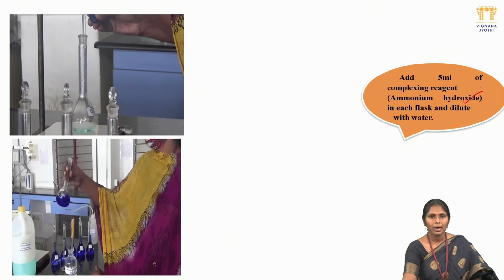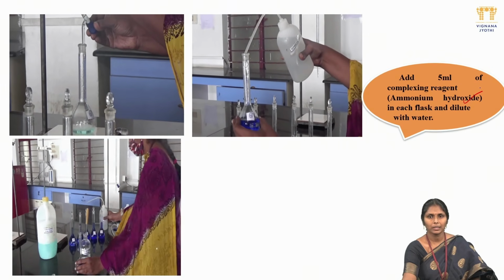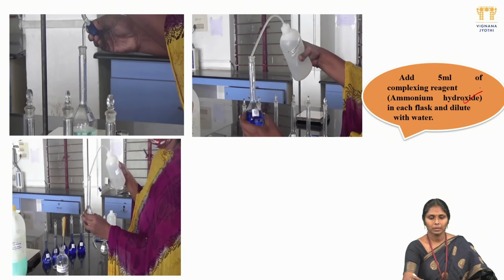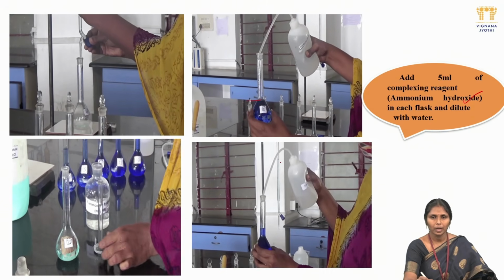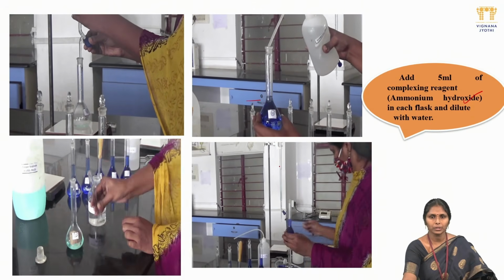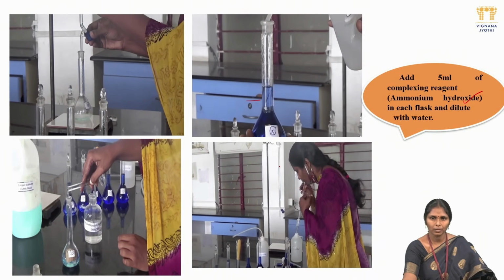Then make up to 100 ml using distilled water. For that, we have to add distilled water up to the neck portion, and for the remaining portion use a dropper up to the mark. Here this is a colored solution, so the upper meniscus is what we have to consider.